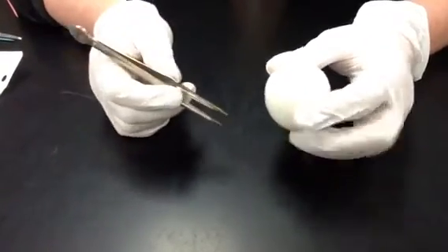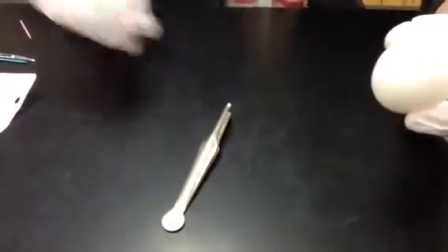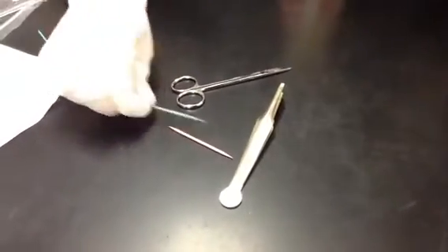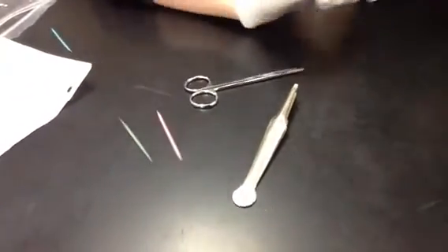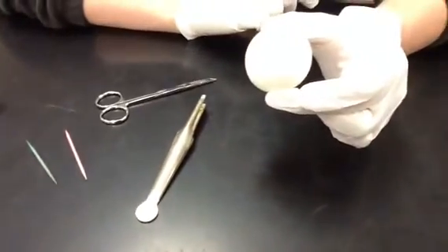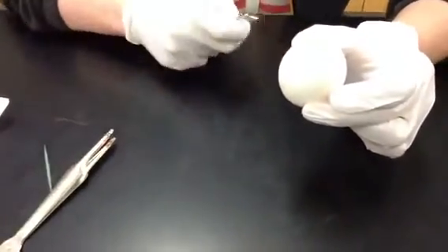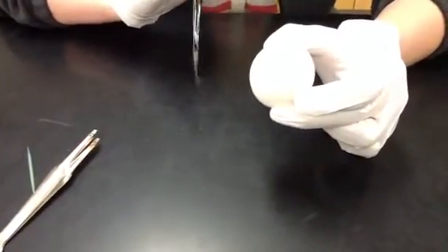So I am using a regular egg that I bought at the store, a pair of tweezers, possibly some scissors, and then some toothpicks here when I do the pointing for you. So you and your partner are going to listen to the video and, like I said, complete it to the best of your ability, and then there are some questions at the end you're going to complete.